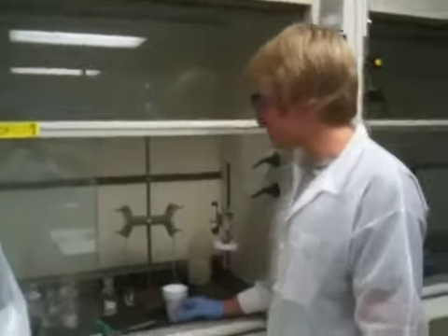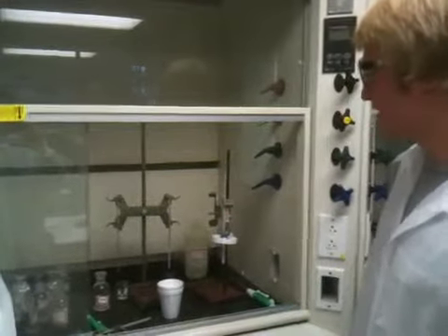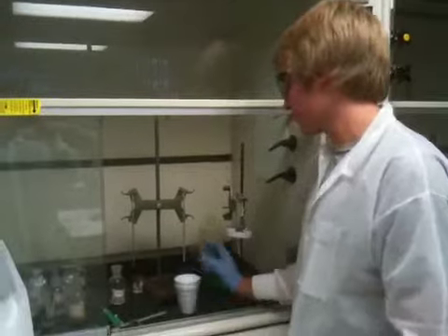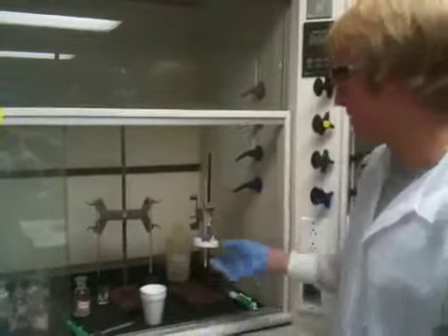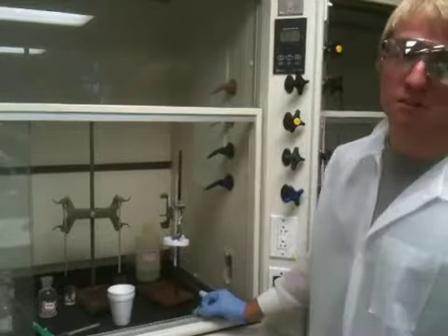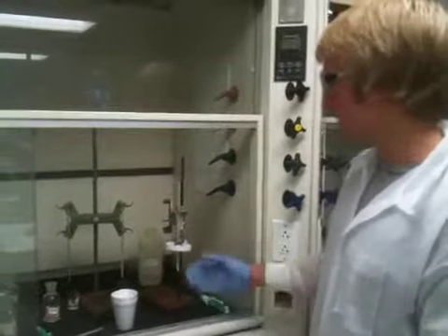What we're doing here is we're adding 6 molar hydrochloric acid to 6 molar sodium hydroxide, and we're doing that inside this calorimeter. So right after the reaction starts occurring, we're going to put the thermometer on to observe the change in heat. This reaction is very exothermic, so it's going to get hotter than room temperature, so we're going to record the temperature.